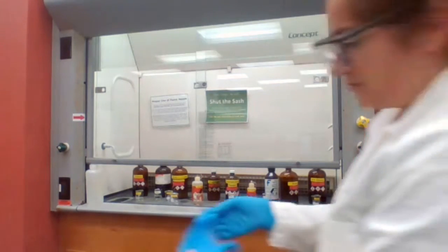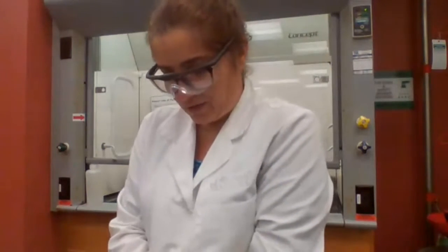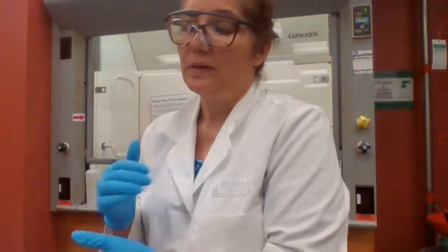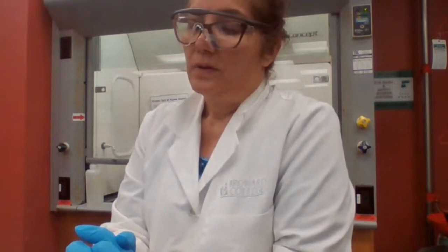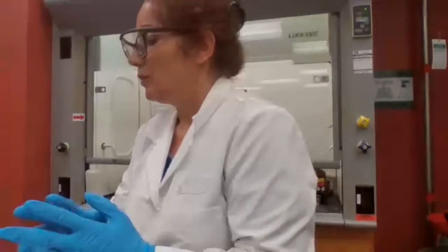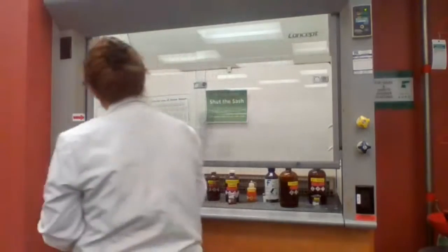Okay, I forgot to ask you to write down the procedure for me while I'm making you wait. So you could write the procedure for me. What do I need to do? What is the quantity? And what are the reagents that I'm adding? Basically, the procedure. So we want to start with the alcohol, right? What's the procedure for the iodoform test? Tell me what to do, please.